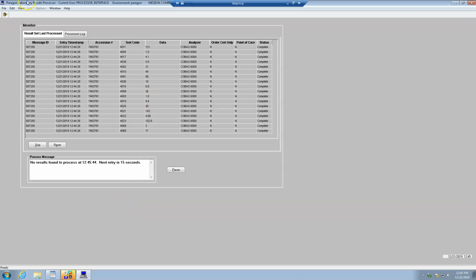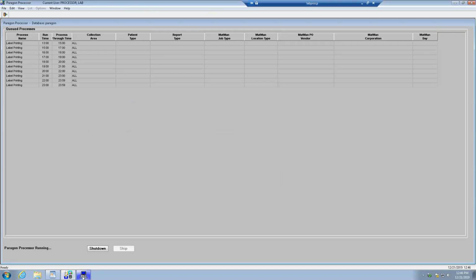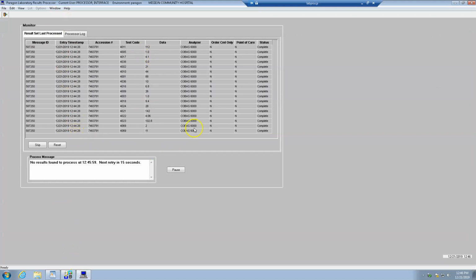Okay, so usually this is what it looks like when you log in. These two processors should be open. This is the Paragon processor for the label printing, and this is the results processor. So both of these should be running. If they're not, that's where your issue is. Okay. So let's say, again, we're going back to the issue with the results not posting. So you've restarted your service on the DI, your interface on the DI, you've restarted your interface on N tier. Okay. When you come back here, a flood of results should start posting. Okay. So this is a way to check your work and make sure that the results are posting.